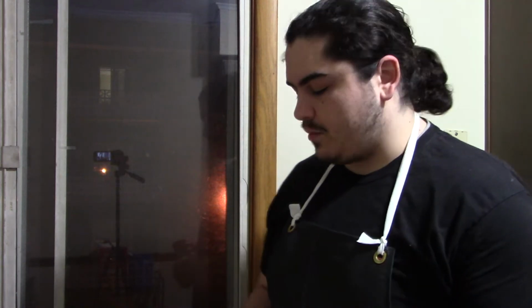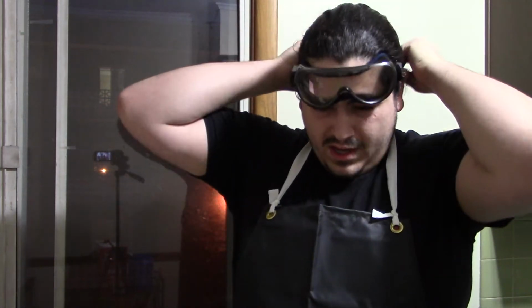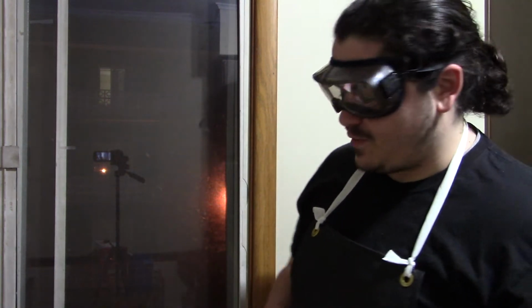I'm going to be following the procedure in the laboratory handout. And I'm going to try to detach the camera so I can show you what I'm doing. I pulled out the old apron from freshman chemistry at WU. When you take a freshman chemistry course, they make you buy your own lab apron and your own pair of laboratory goggles. So I understand that many of you might not have this, but I figure I might as well be in character for this experiment.